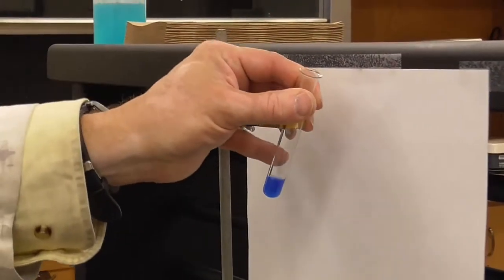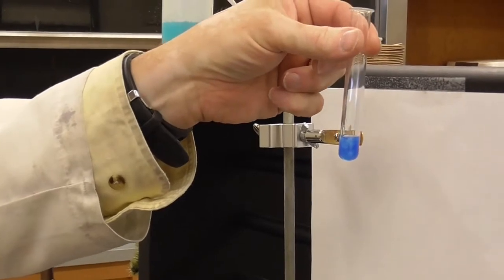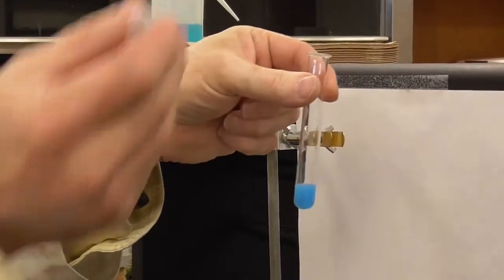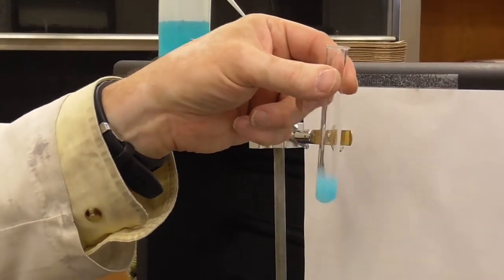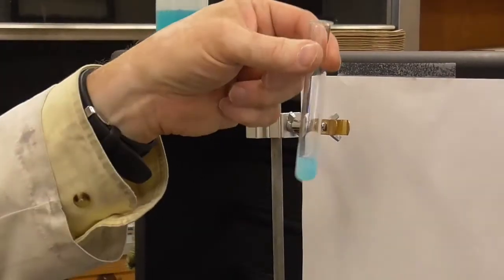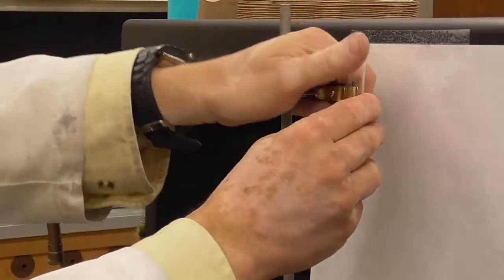Once again, let me take it off so I can mix it easier. 1, 2. You can already see a little bit of a difference, hopefully. Swirl that up. Oh yeah, look at that. 3, 4. Wow, very cool. Nice, nice. Let's just add a couple more just to make sure. There's 2 more. I think we're just about right back to that nice light blue color. Okay. That is LeChatelier in action.